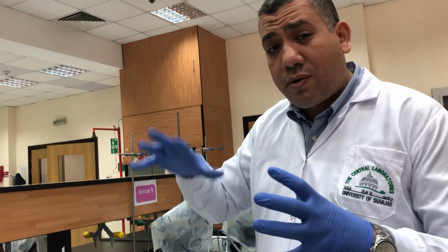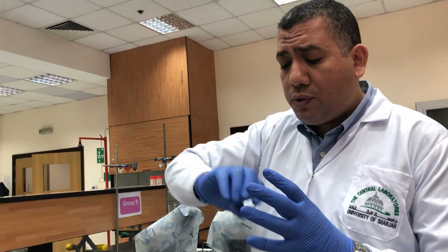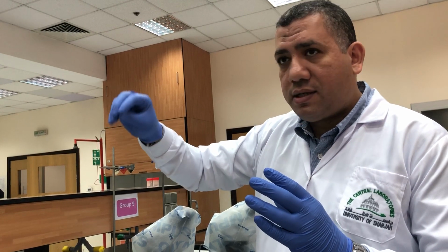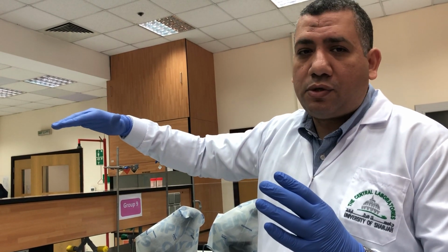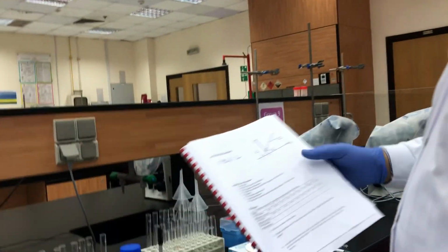So if you add more concentration of protein, even with the same amount of enzyme, what will happen? Up to a certain point, there are no more results. It will reach the maximum activity, which is called Vmax. We need to prove this here. So we'll start by preparing 9 tubes, as mentioned in the table.